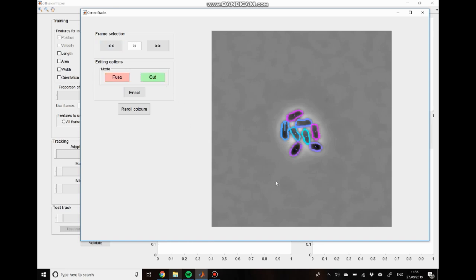And if we switch to the cut mode, we can see exactly why that's happened. You can see that we have this large mother cell that has been assigned to one of its daughters. And that's what this arrow represents. That indicates the motion associated with the current track. So if we move to the next time point, you can see that it's associated with this mother and associated with this daughter, sorry. And if I now just re-roll the colors just to make this a bit clearer, hopefully this will work. You can see that this is the same object, but this daughter is separate. So that's telling you that this track moves to here, but this is a separate track.